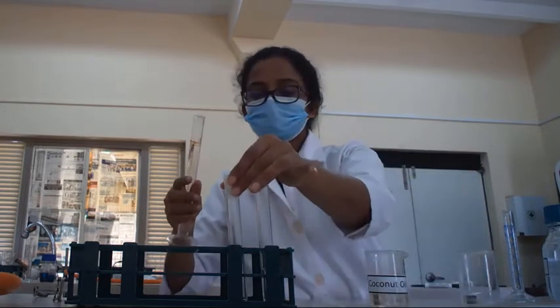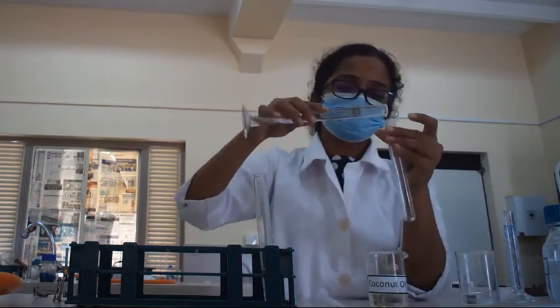Then I am going to add it into a separate test tube.